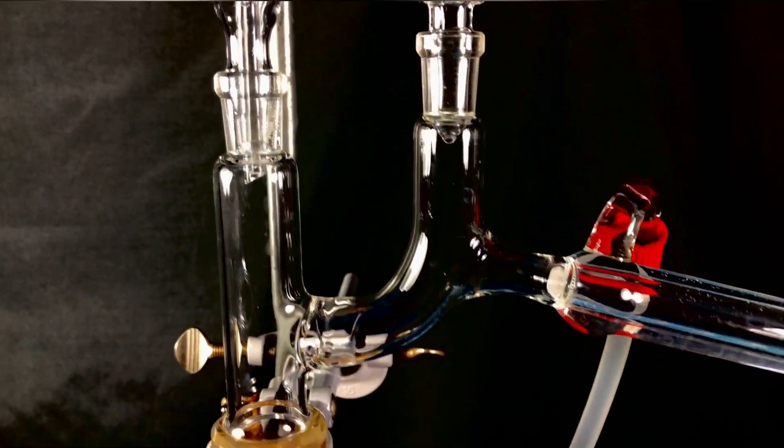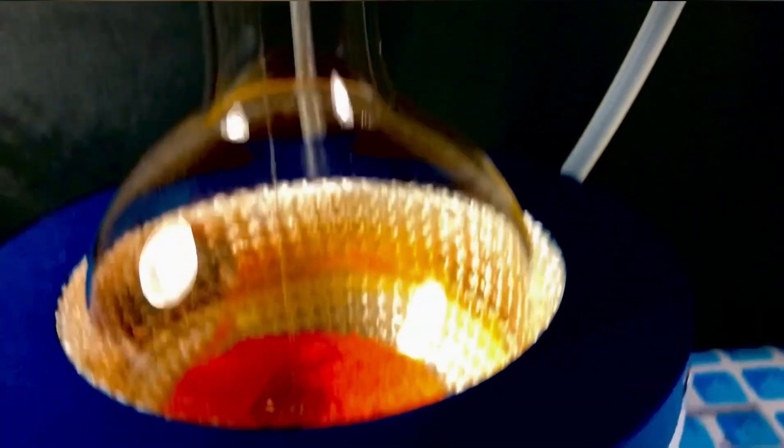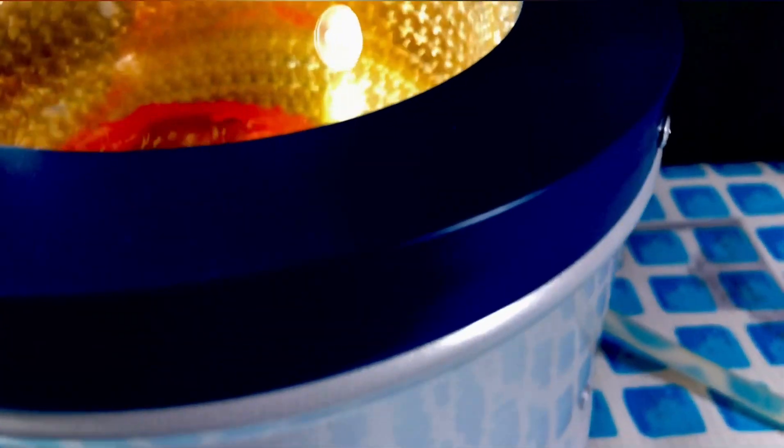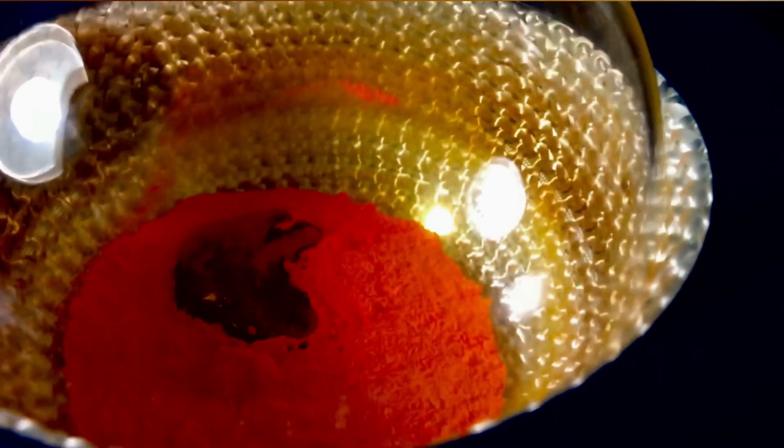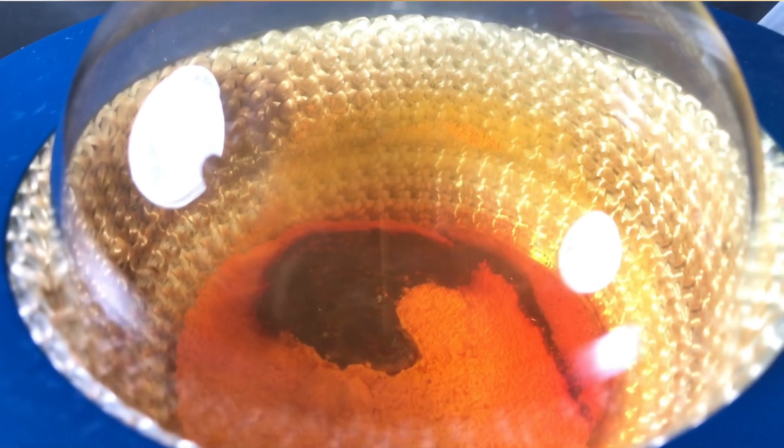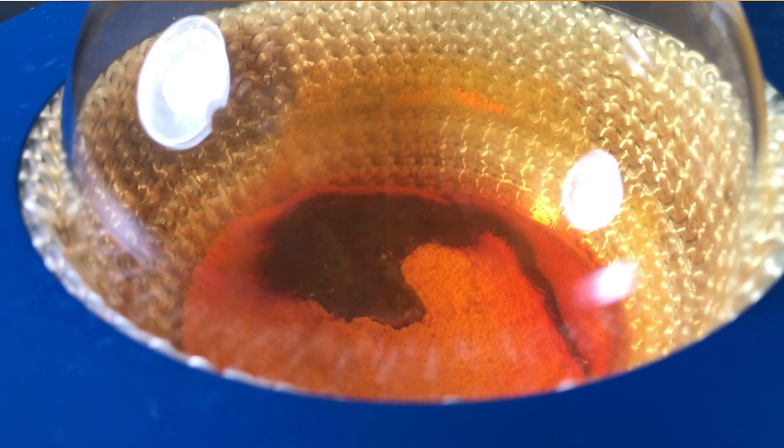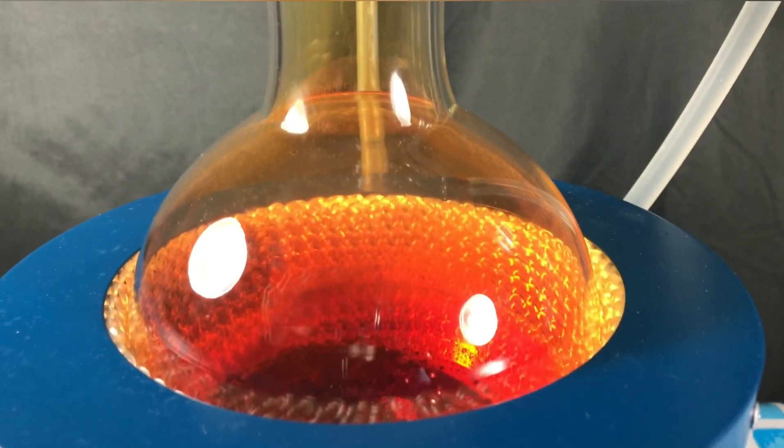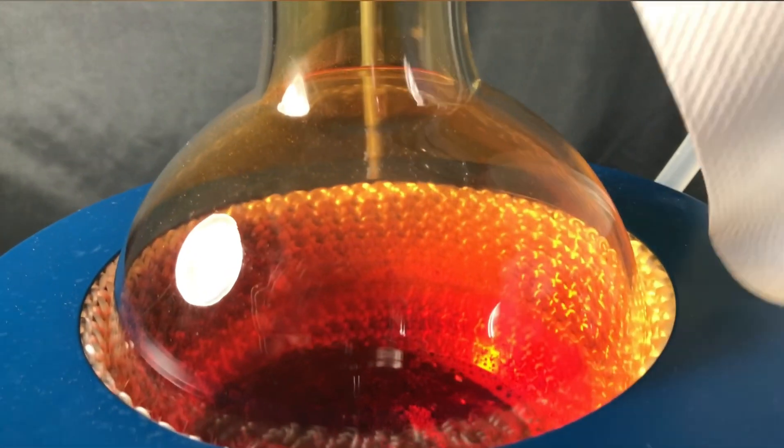The stopcock of the addition funnel was opened, the sulfuric acid was added slowly. You can see that the color of the solid changes. The reason for that is simple. A chemical reaction takes place, but actually it's not just one chemical reaction, it's three chemical reactions. Three chemical reactions are taking place simultaneously.